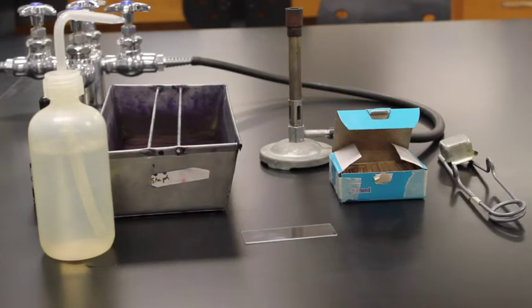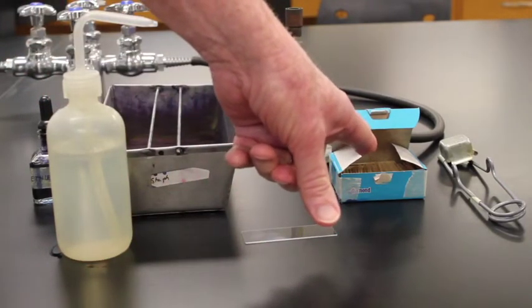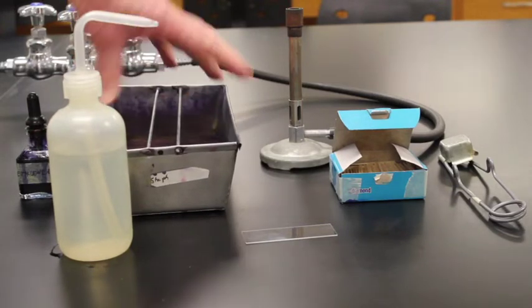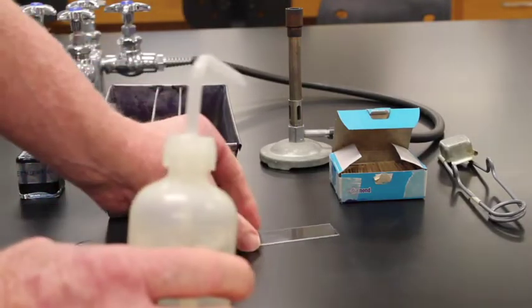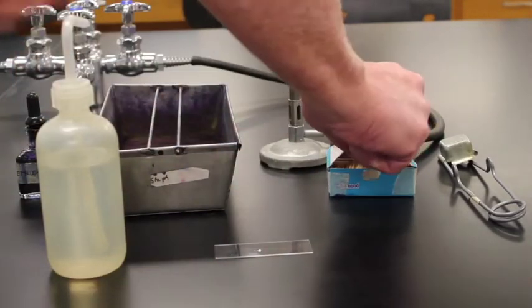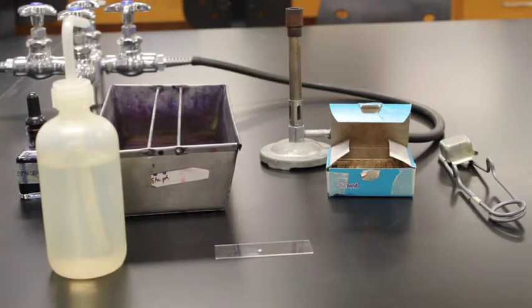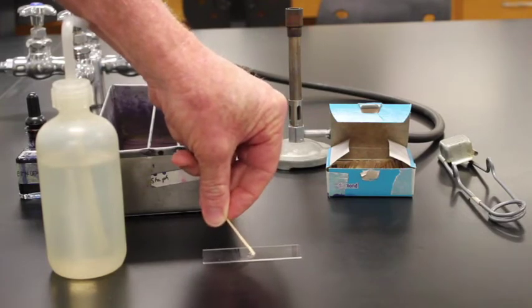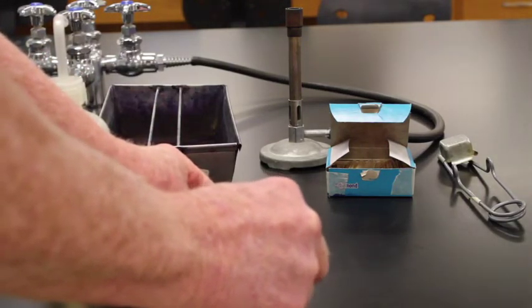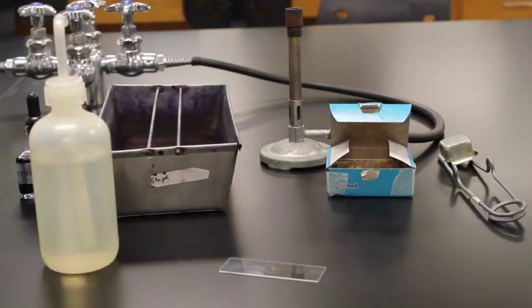Next we want to look at human cheek cells. To look at human cheek cells I have a microscope slide, toothpicks to get cheek cells off my cheek, a stain called Methylene Blue, a staining tray, and a Bunsen burner for heat fixing the slide. The first step is to take a drop of water and put a tiny drop on the slide. Then I grab a toothpick and rub it on the inside of my cheek to get cheek cells on that toothpick.